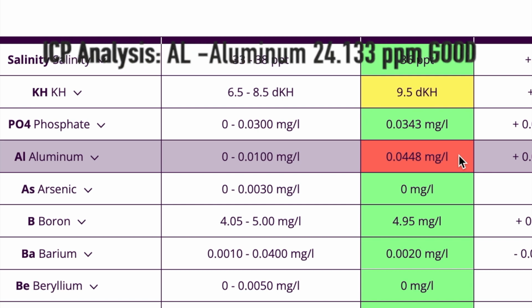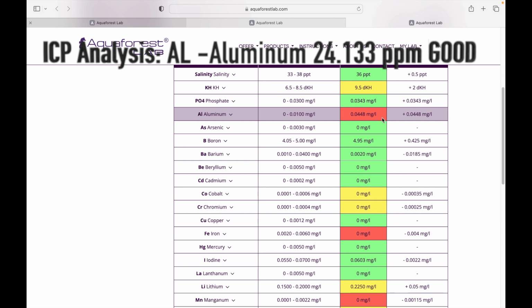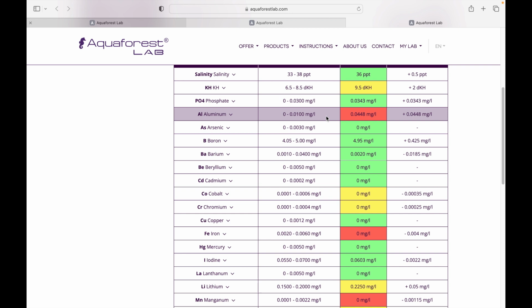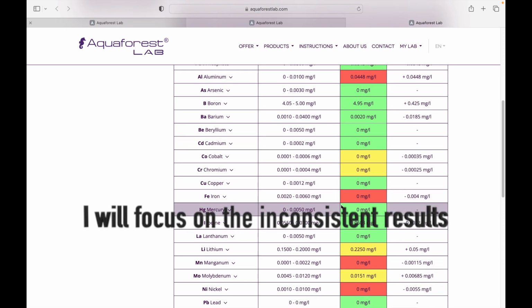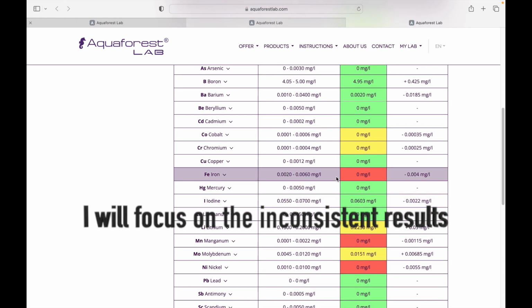So if you recall, we had iodine on the last test showing that we had a problem. Now let's go back and have aluminum here. Yeah, the last test showed aluminum was fine. So ICP Analysis says aluminum's fine, and Aqua Forest Lab says aluminum is high. Let's move on. We're just going to hit the main points here, the ones that are interesting. Iron, none. Okay.